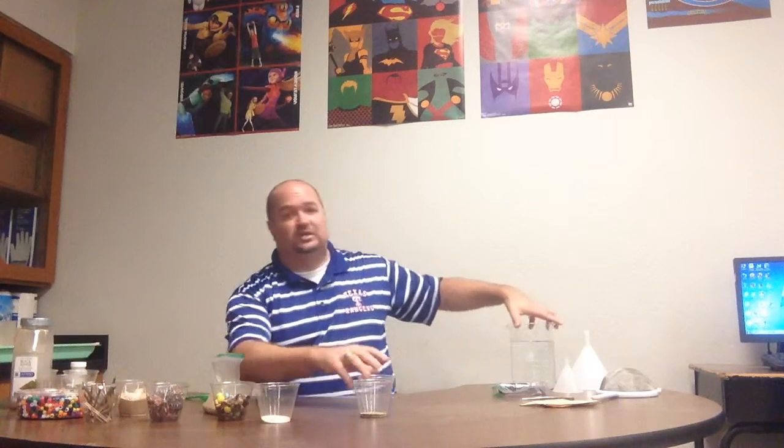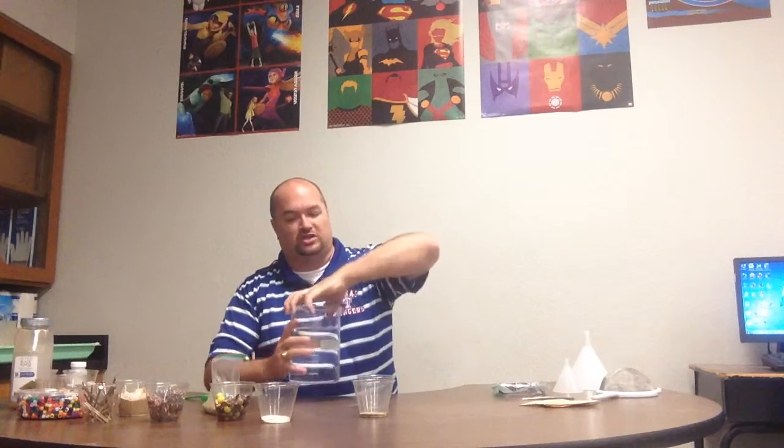So, which of those properties could we potentially use? And if you said solubility, you were right. And it was also the first thing I said too. That was also a massive hint. So, we need some water. I just happen to have a pretty large container of water here.